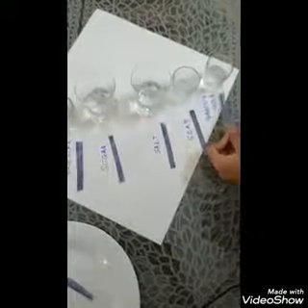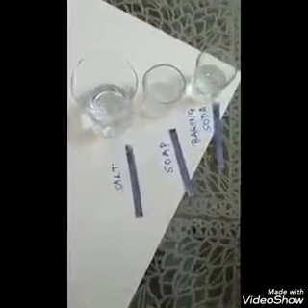You can see that it is slowly changing its color. Now let us test with the liquid indicator — add a few drops to all these solutions.